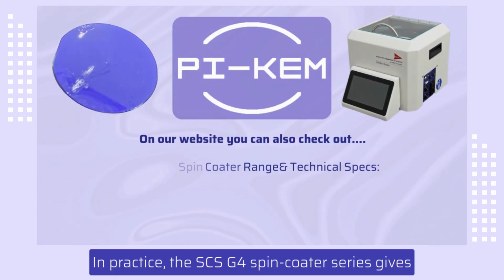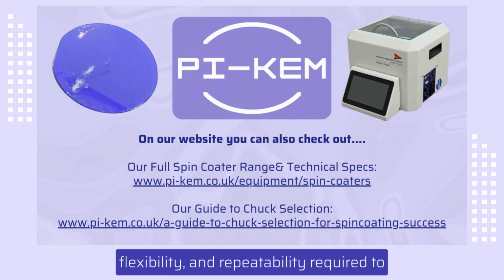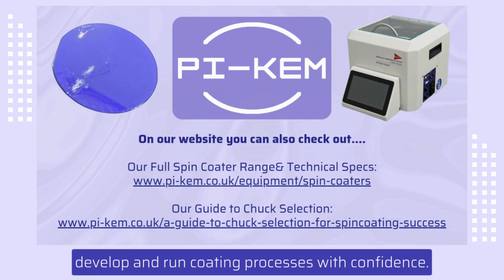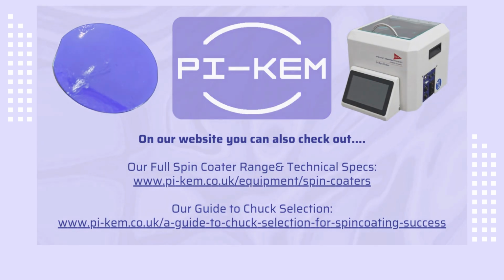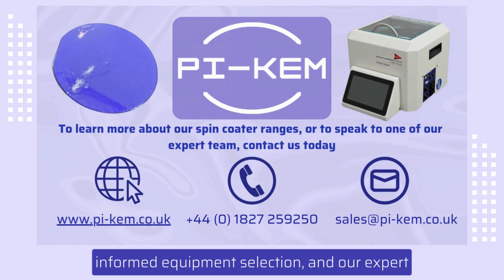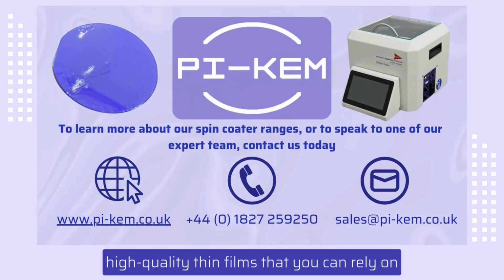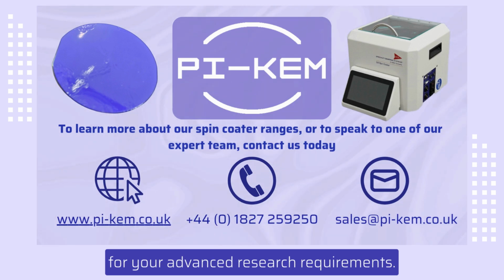In practice, the SCS G4 Spin Coater series gives users the control, flexibility and repeatability required to develop and run coating processes with confidence. With the right techniques, informed equipment selection, and our expert support, spin coating can deliver consistent, high-quality thin films that you can rely on for your advanced research requirements.